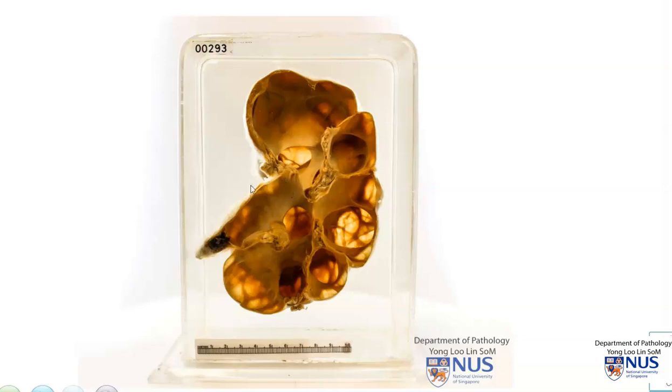Hello, this is a specimen of a kidney which has been longitudinally bisected, and we can see that there are several very obviously abnormal things. First of all, the kidney is markedly enlarged. The normal size of a kidney from the superior to the inferior pole is roughly about 11 to 12 centimeters. And if you look at this scale, this being the 10 centimeter mark, you can see that this kidney is enlarged. The second very obvious abnormality is the fact that the entire pelvic calyceal system is severely dilated.